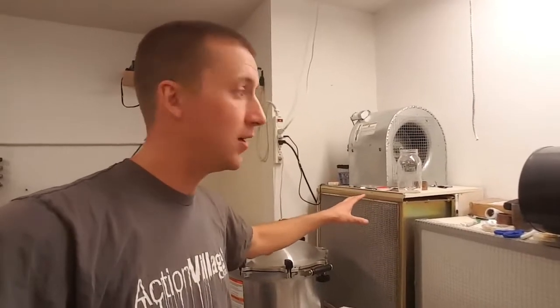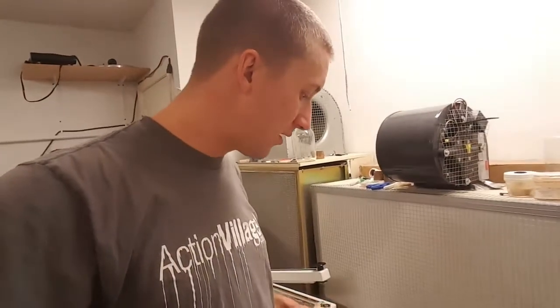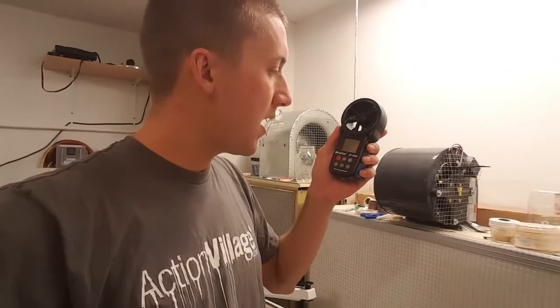I've had no issues with working in front of the faster flowing hood, and how I test that is with a flow meter anemometer. This one was about $20 on Amazon — it's a Hold Peak HP-866B.